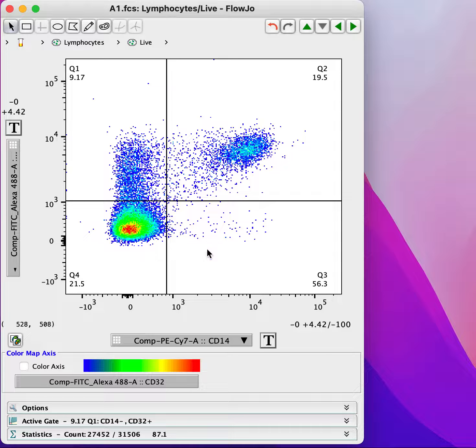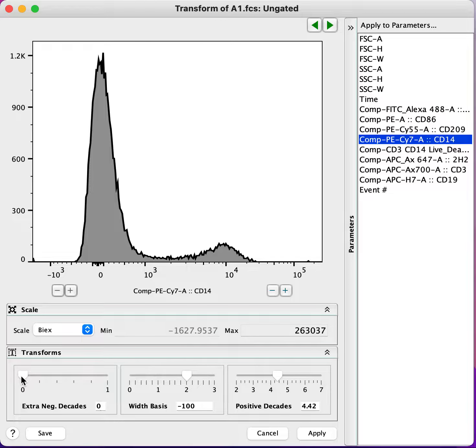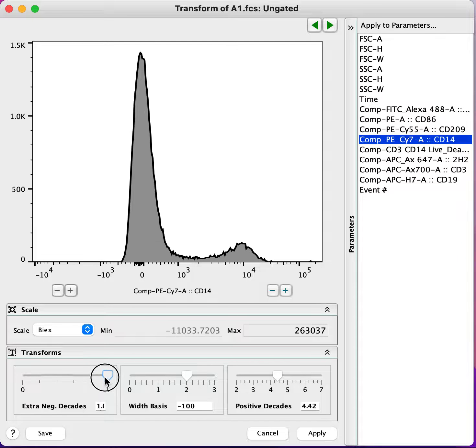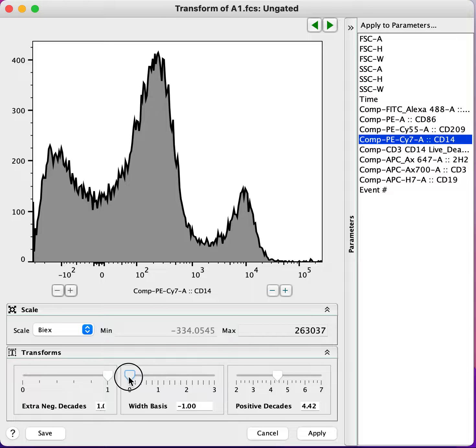And let's see what happens if we transform the scale. So we're going to transform the x-axis here. I'm going to add an extra negative decade. And I'm going to change the width basis here. And watch what happens to this negative peak here when I change the width basis. So you can see that it now appears as if there's two peaks with an anti-mode in between them here. Let's apply that.